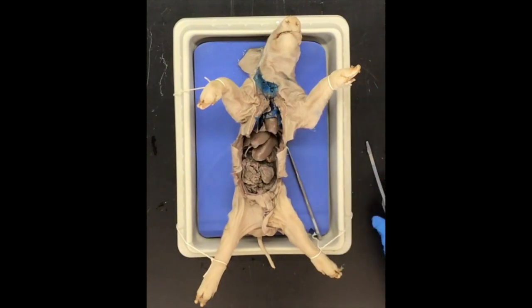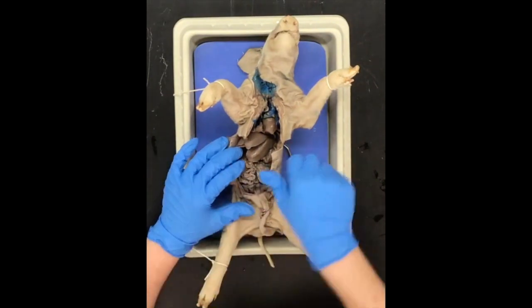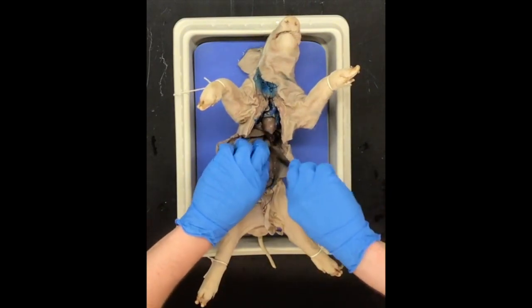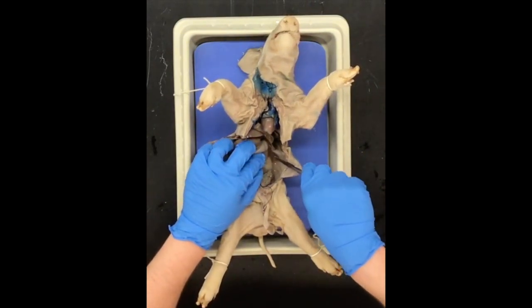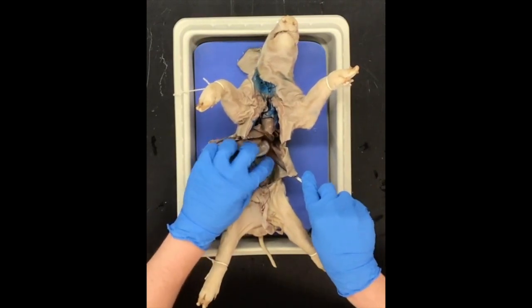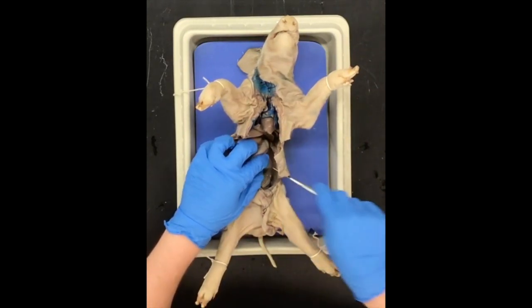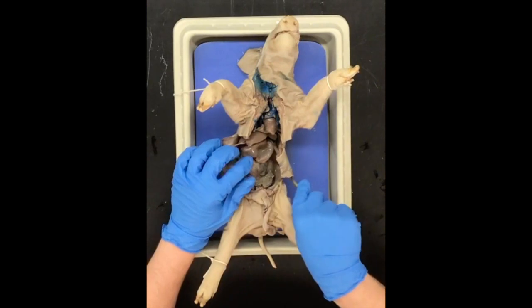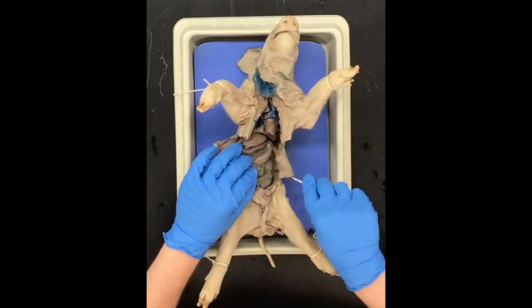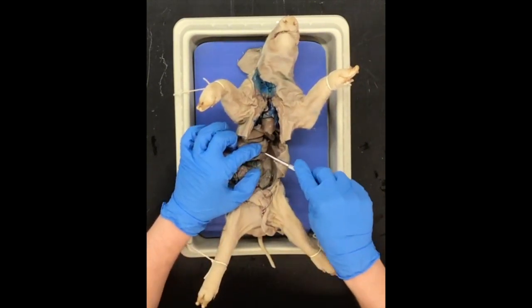Some other organs I want to mention: towards the back, almost connected to the back of the abdominal cavity, we have these bulges right here. They're covered in connective tissue, but those bulges are the kidneys — they're kind of towards the back of the abdominal cavity region, almost connected to the wall. We'll see if we can separate that out from the wall in a second.